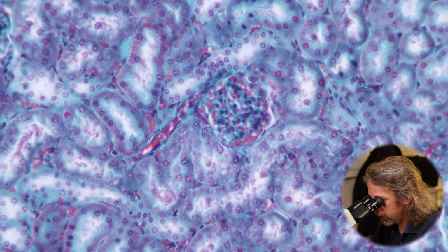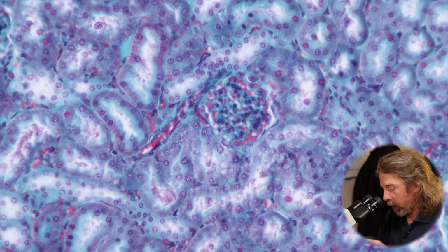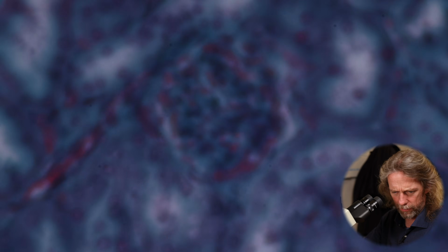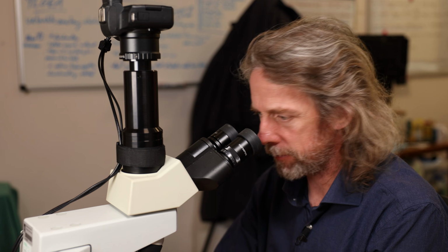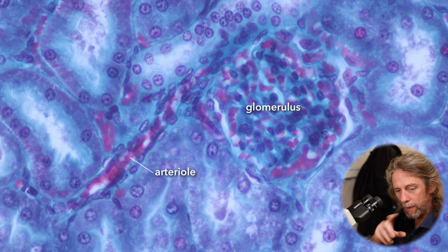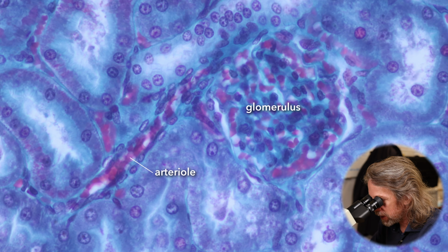There we've got a glomerulus, and we can see the arteriole coming into it or going away from it. I mean, we couldn't tell which way it's going, right? And there's your renal corpuscle, so there it goes in and then wiggles around in the glomerulus and then back out the other side. Of course, we can't see it coming out the other side because we haven't got the 3D picture.